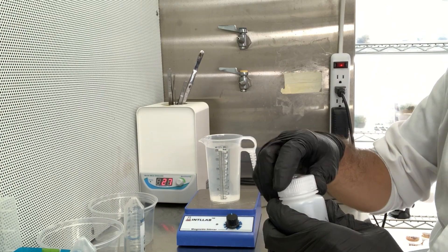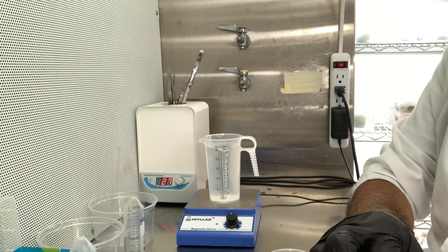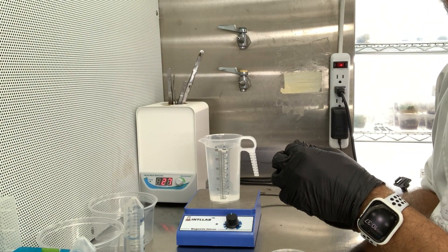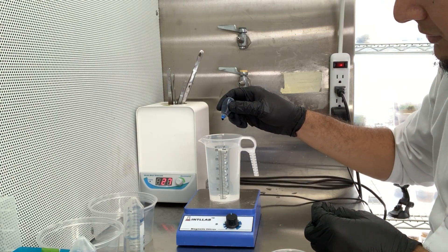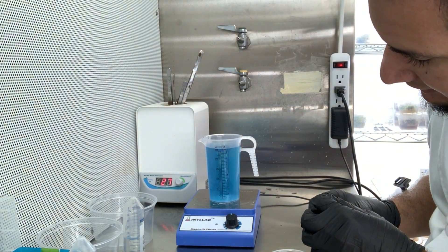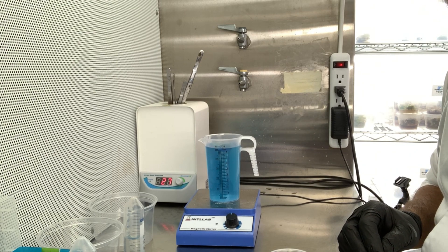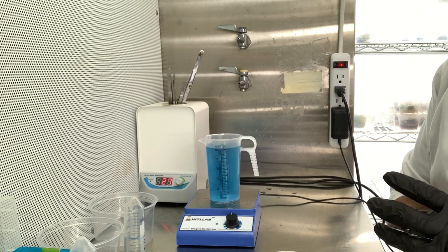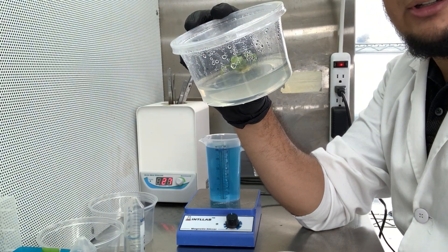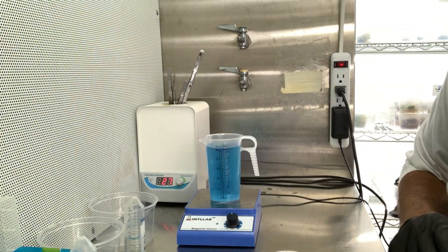The last thing I want to do — because I have a lot of media for different plants laying around — is add some food coloring so I can distinguish what media is for what plant. Just one drop, that's all it needs. Now I need to add the gelling agent. Every time I've worked with Monstera deliciosa I've been using gellan gum, but I want to switch and use agar this time.